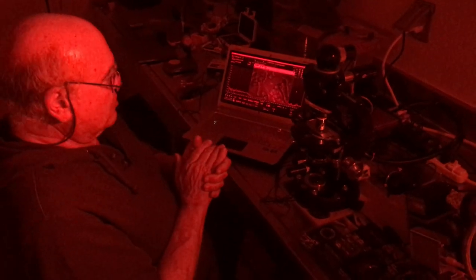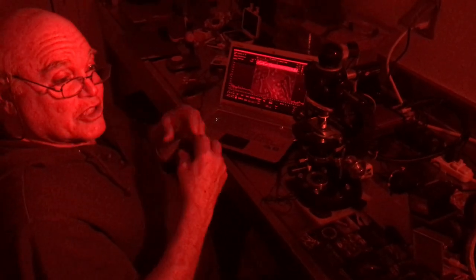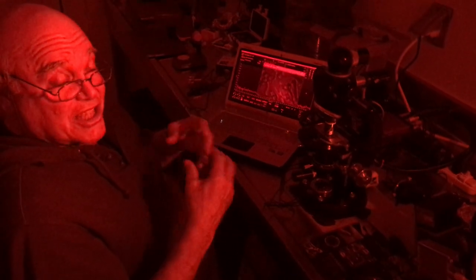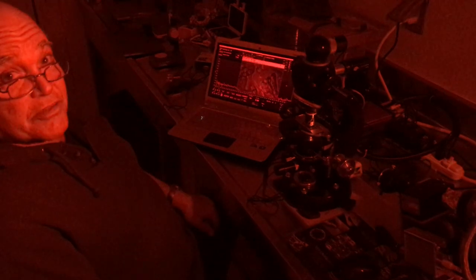What this instrument does is measure the light absorbed by a part of a photoreceptor cell that contains the visual pigment, which is responsible for making that cell sensitive to light. This screen is captured by an infrared-sensitive camera. That's an actual infrared image of part of a retina that's been macerated, freeing up these cellular elements. These long elements right here are called outer segments, and that's where the visual pigment is.